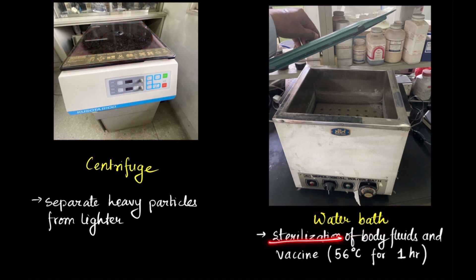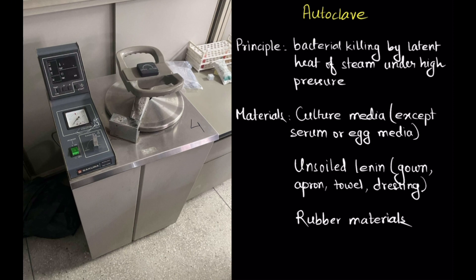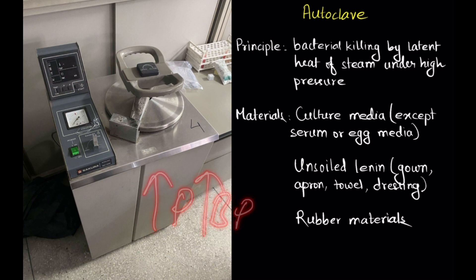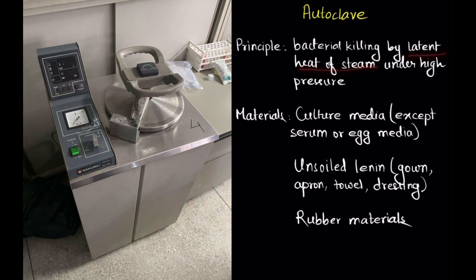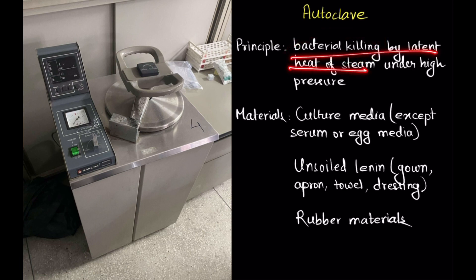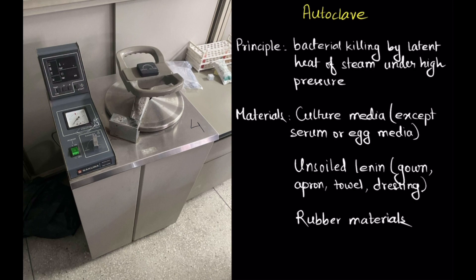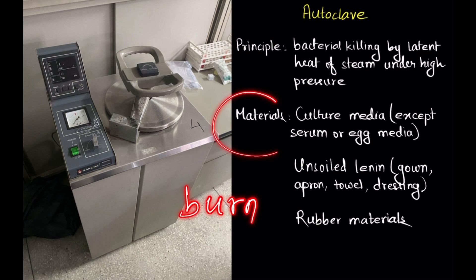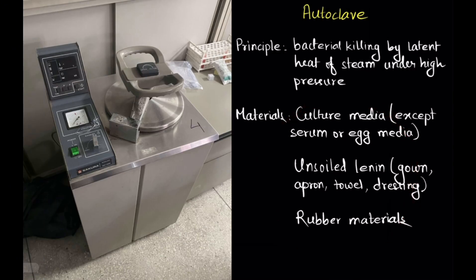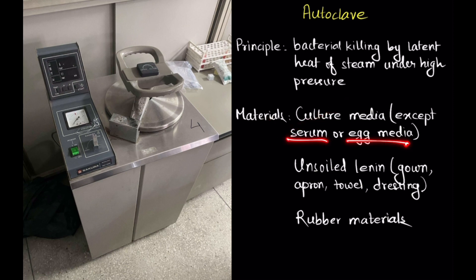Water bath is used for sterilization of body fluids and vaccines. The principle of autoclave is that at higher pressure, the boiling point of water is higher as well. The latent heat of the steam of that boiled water is then used to kill bacteria — bacterial killing by latent heat of steam under high pressure. The materials sterilized in autoclave are those that cannot be sterilized in hot air oven, because inside the hot air oven these materials would burn, like culture media. Except serum or egg media, which are sterilized by tyndallization.